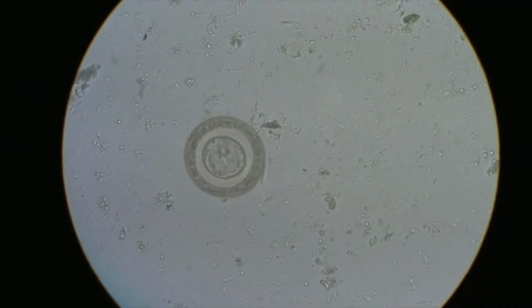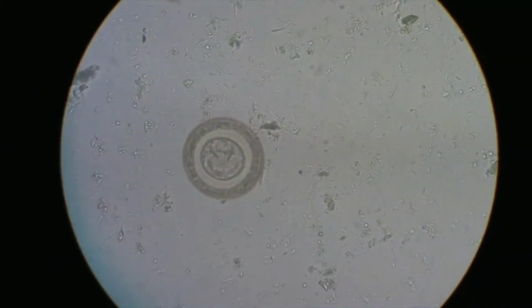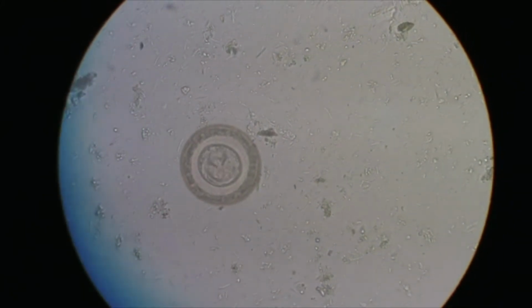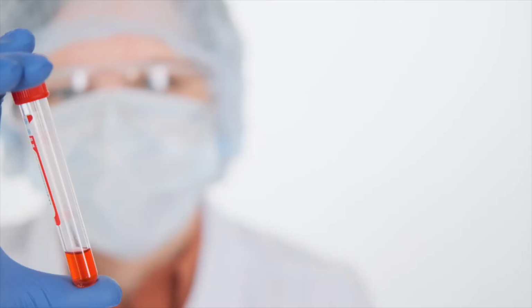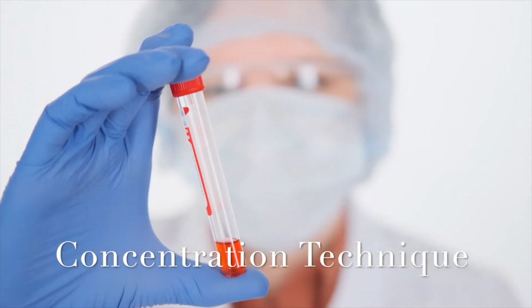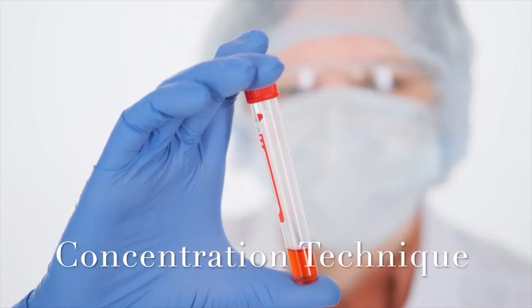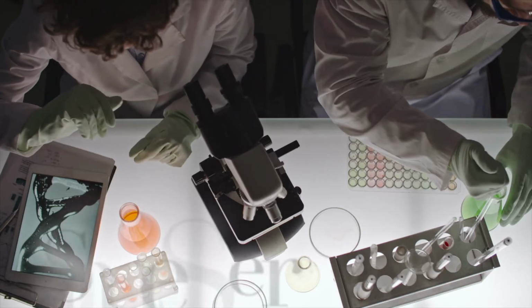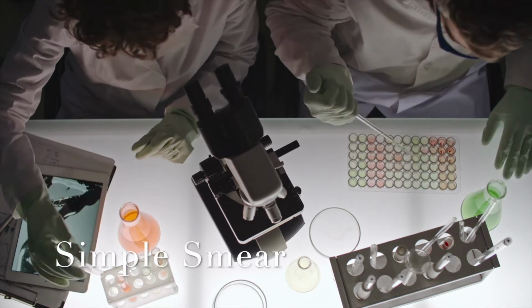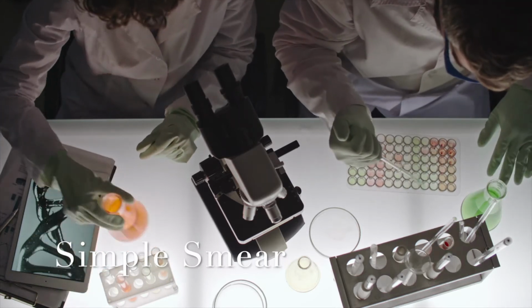by parasites. There are two ways to identify the parasite's eggs, which are the concentration technique and simple smear. The first method requires the medical profession to operate with the microscope, and the second method is to use the special microscope to detect the parasites, which any person can operate.